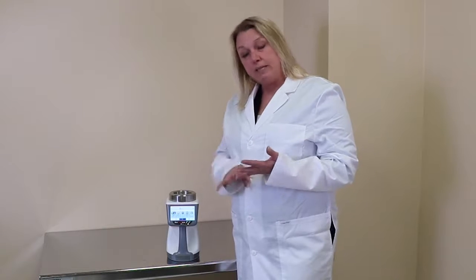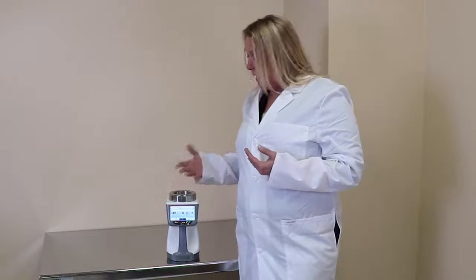So we're going to talk today more about setting up recipes and locations and users for the instrument and see some of the reports. So if the instrument has an issue and there's an alarm, you'll be able to see any of that on the report. So let's go into the software.